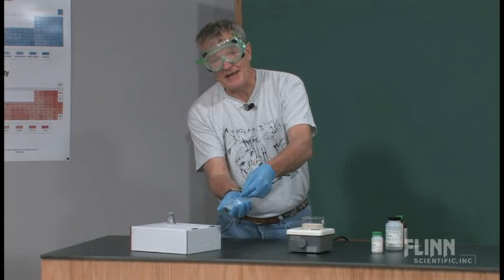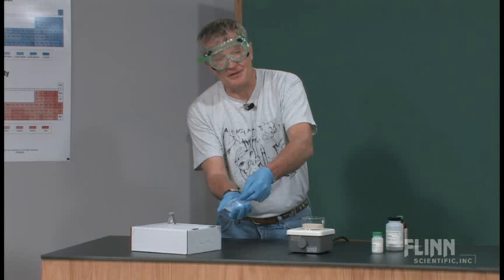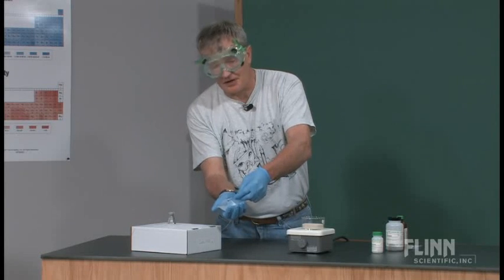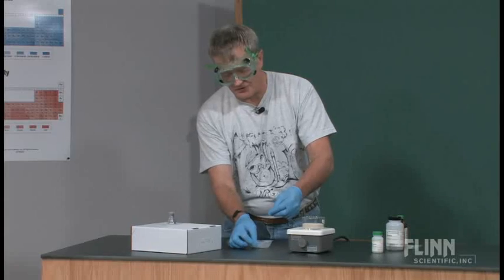And so I've gathered a small quantity in here. I would weigh this ahead of time, or I would weigh this in the lab. I'm not going to do that at this point.